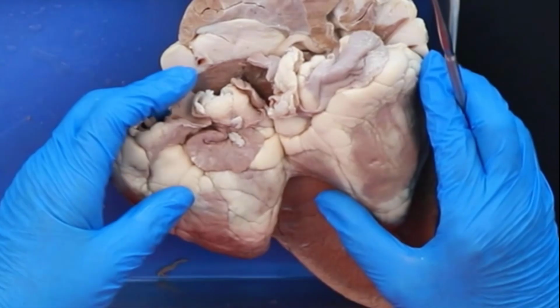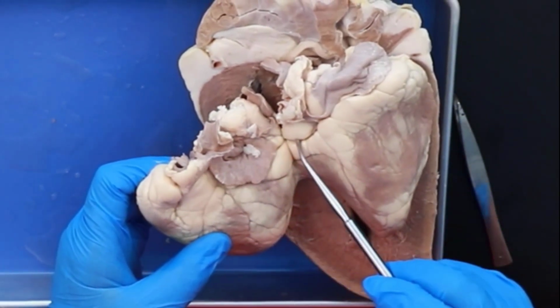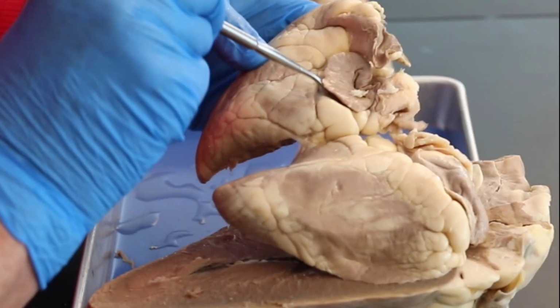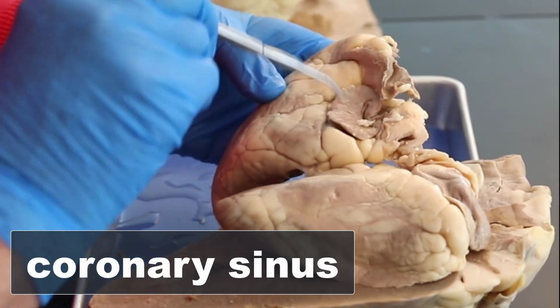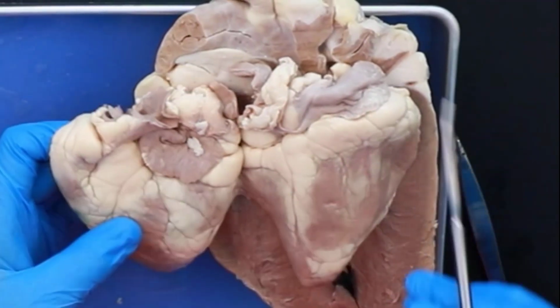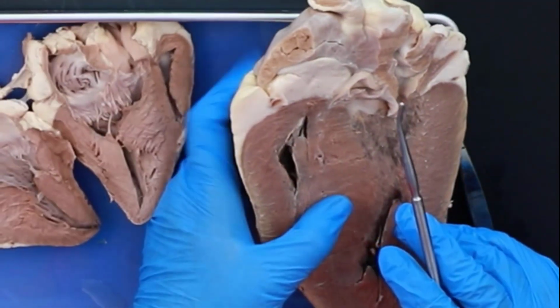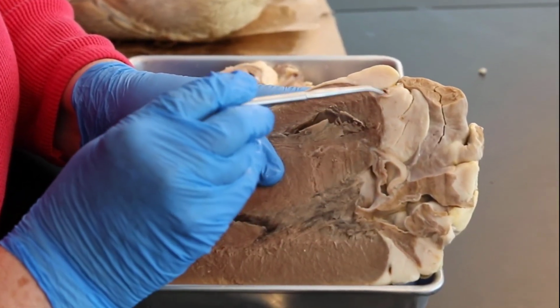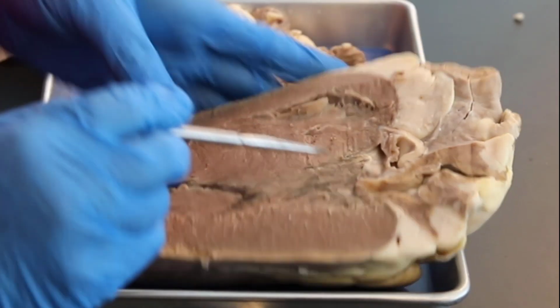That's all it does. If you look here, this is the separation between the atria and the ventricles. All right. This is where your coronary sinus is. This is where the coronary vessels dump into. And if you look here in our cow's heart, you can see all the fat around it, and you can see the vessels right here coming through. Okay?